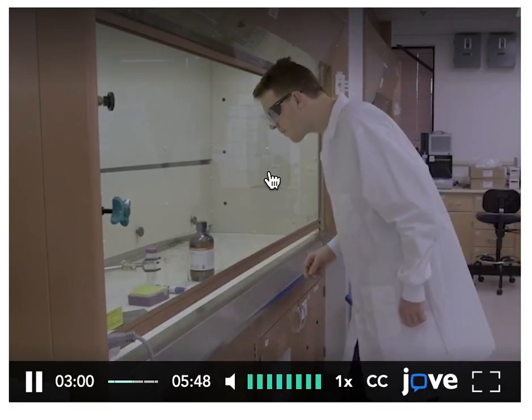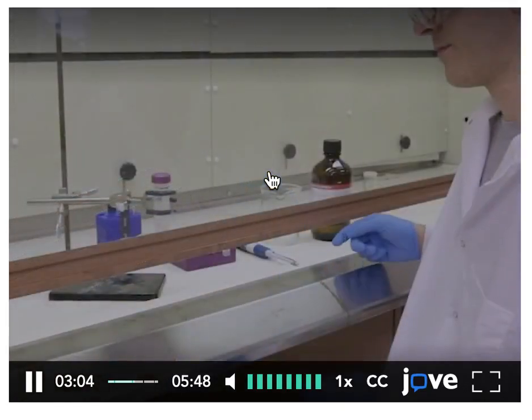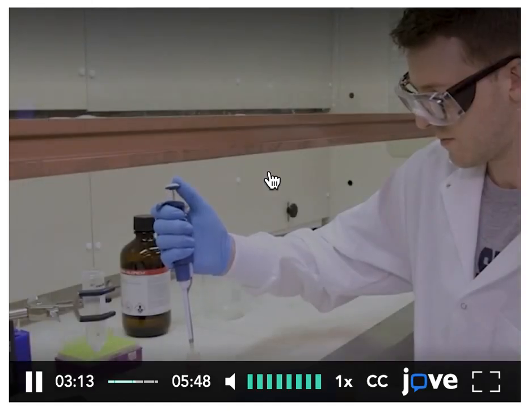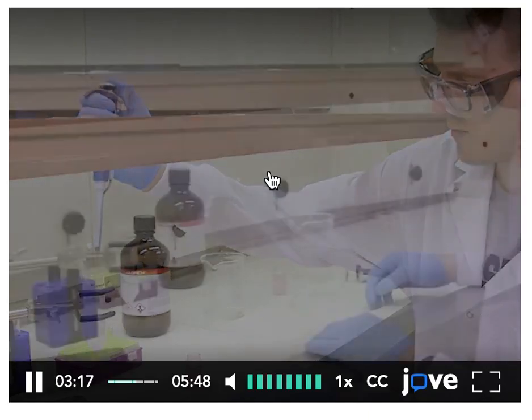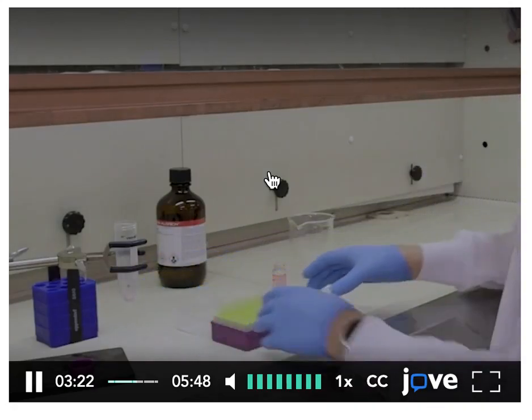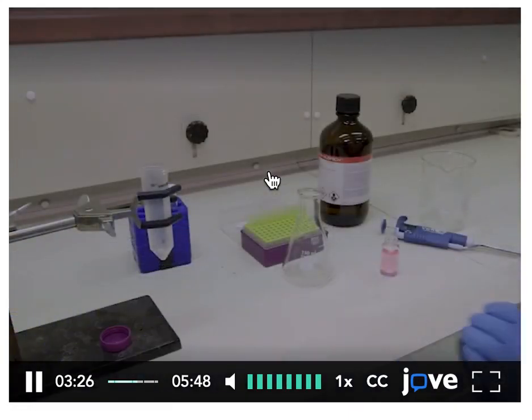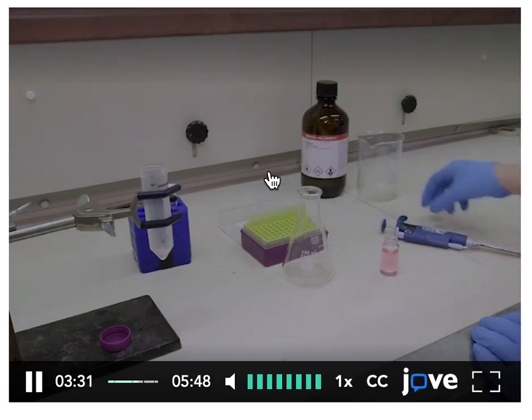To use a fume hood safely, always wear appropriate personal protective equipment. Raise the sash up only to the indicated maximum safe working height, ensuring sufficient airflow through the hood. To prevent exposure to harmful fumes or particles, work with only your arms inside the hood, and never let your head enter the workspace. Also, to make sure that the velocity is sufficient throughout the hood, keep the workspace uncluttered, and move all items at least 6 inches away from the hood face.